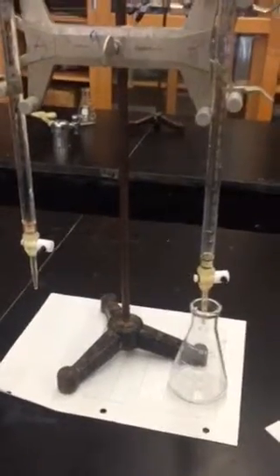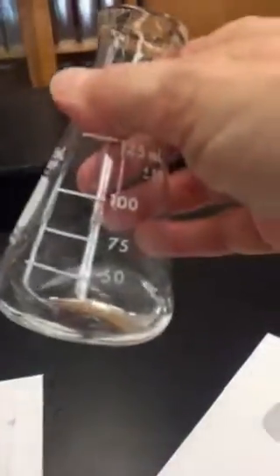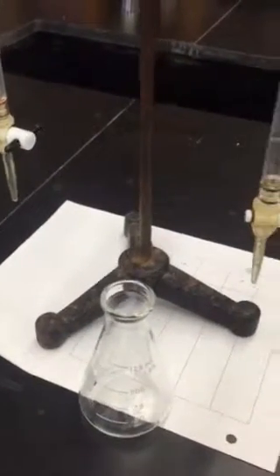You need to see what happens and come to lab and see for yourself. Then you're going to dump this out — this will be a neutralized mixture in the flask. Dump it out in the sink, and then rinse it out with some distilled water. A couple rinses will do it, and then you can repeat. So dump, rinse, and repeat, and you're good to go. See you in lab.